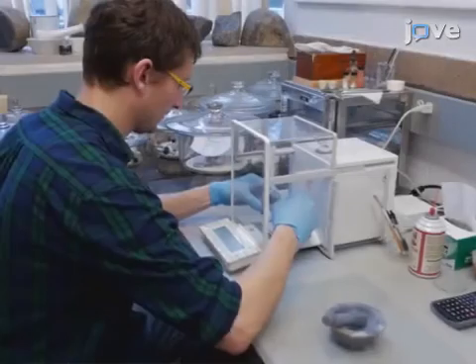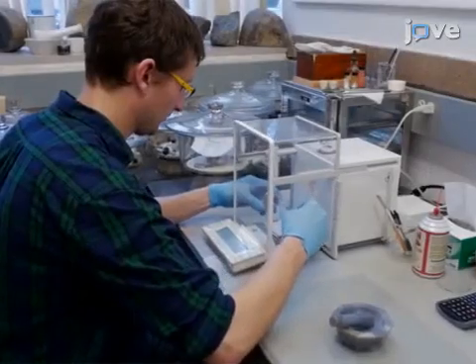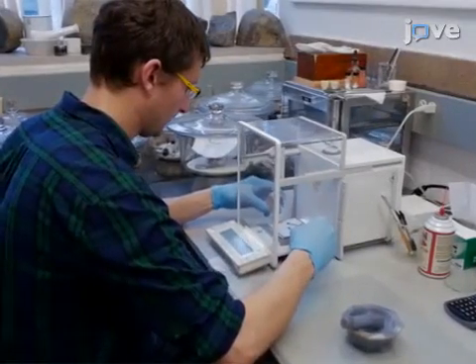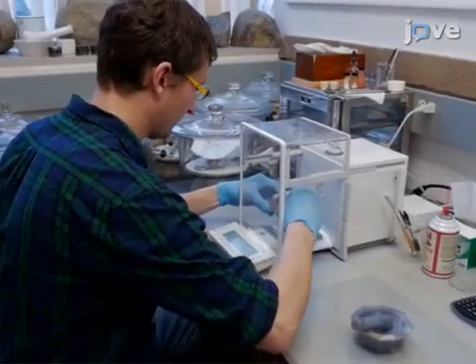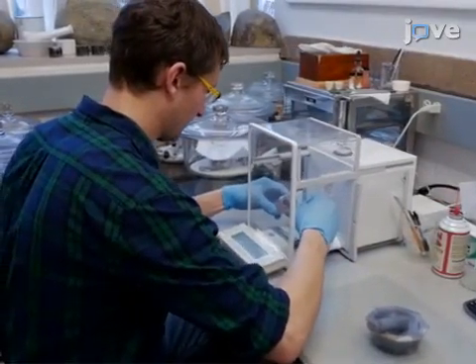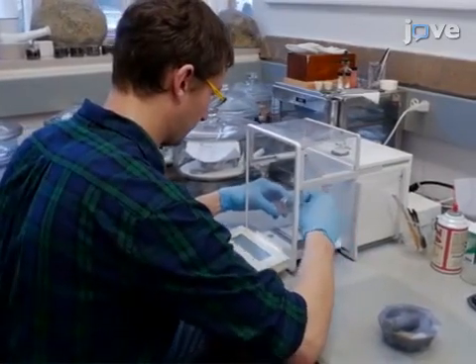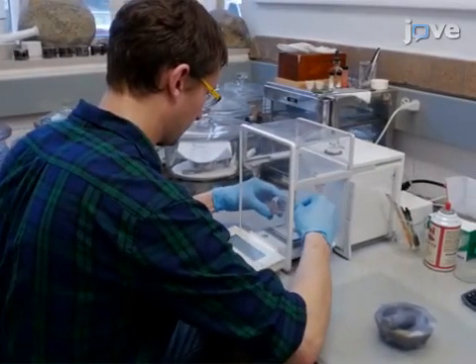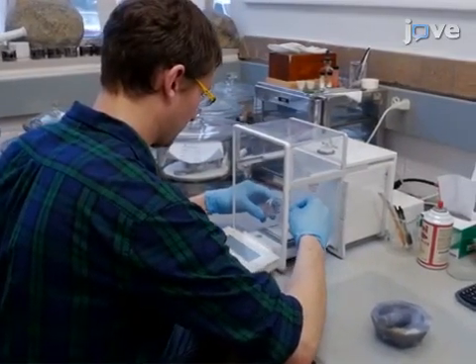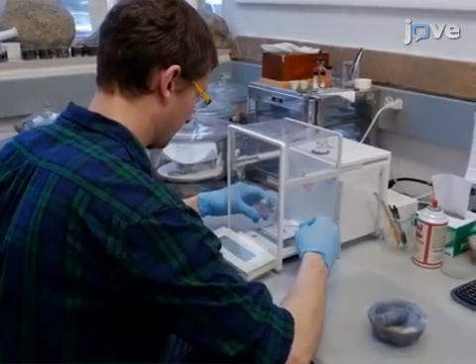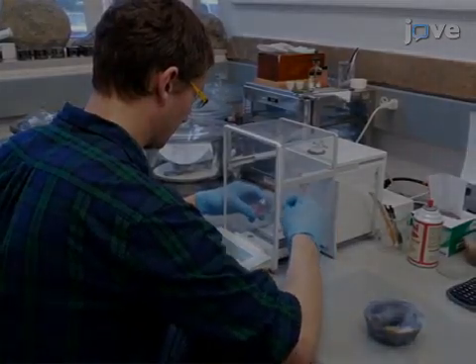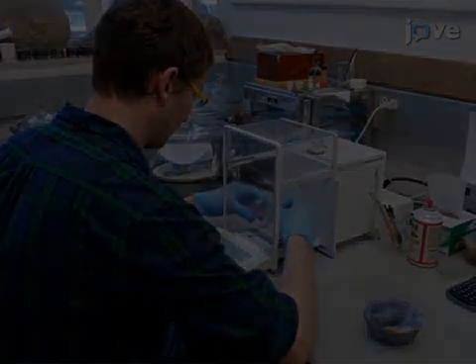Weigh the desired amounts of component oxide or carbonate powders and add to an agate mortar. An iron-free mixture weighing approximately four grams should provide sufficient starting material for an extensive suite.